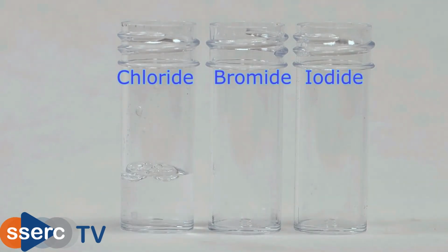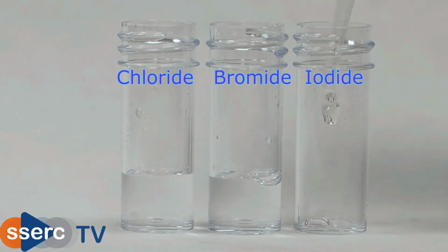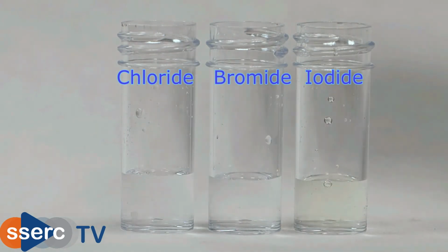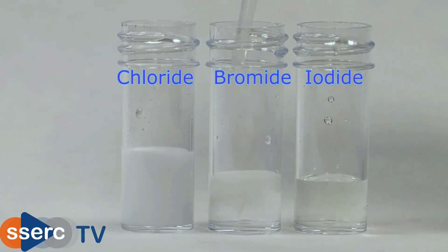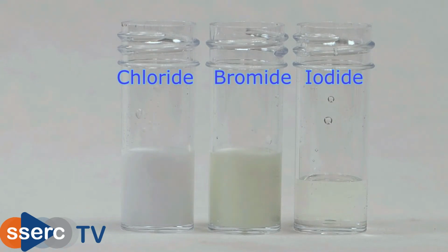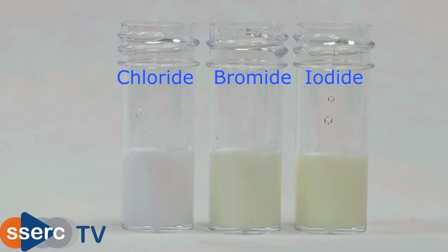Next, we'll look at the halides. We have potassium chloride on the left, potassium bromide in the middle, and potassium iodide on the right. And we add a small amount of silver nitrate solution to each one. As you can see, you get a white precipitate with the chloride, a creamy coloured one with the bromide, and a slightly yellower precipitate with the iodide. If the bromide and iodide precipitates aren't clear, you can try to dissolve them in ammonia. Silver bromide will dissolve in concentrated ammonia, but the silver iodide won't.